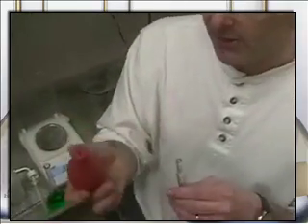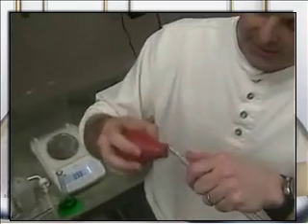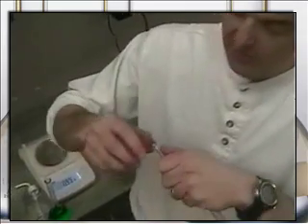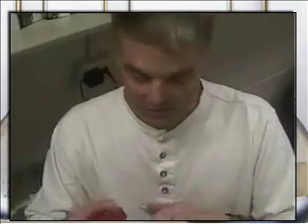And so I have this bulb. What do you call it? It's a sucky bulb. Although chemistry never sucks. Remember that. Everybody say that. Chemistry never sucks. Pushes. Okay.